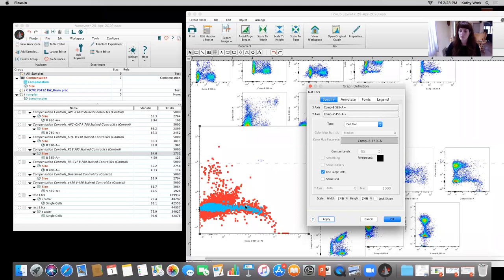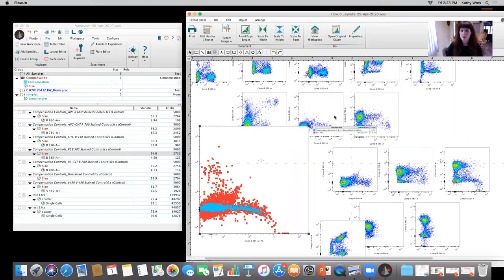And the third is you want to make sure that you're using the appropriate fluorochrome. If it's FITC, it needs to be FITC. If it's Alexa 488, it needs to be Alexa 488. You can't mix and match GFP for Alexa 488, FITC for Alexa 488, anything like that. And that goes for all of the fluorochromes. Okay, so that's a good example from a friend of mine in another SRL as to why you can run into problems with the compensation control.